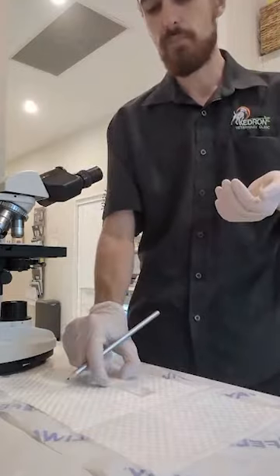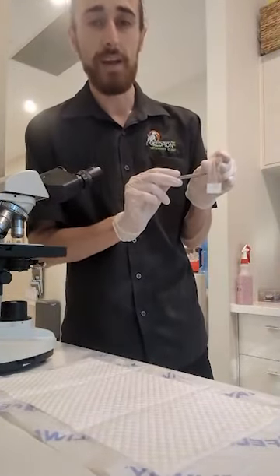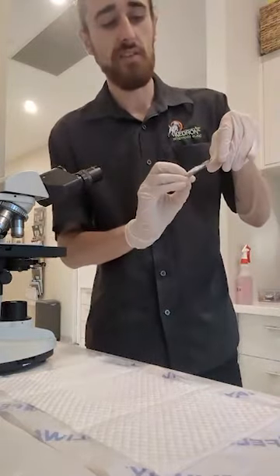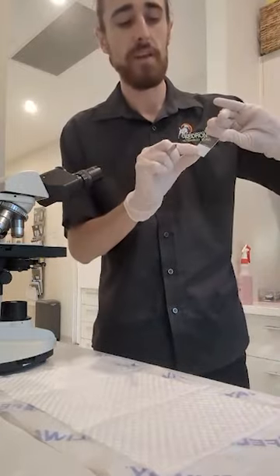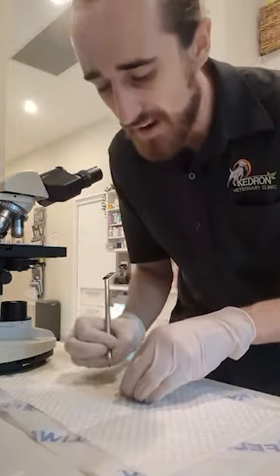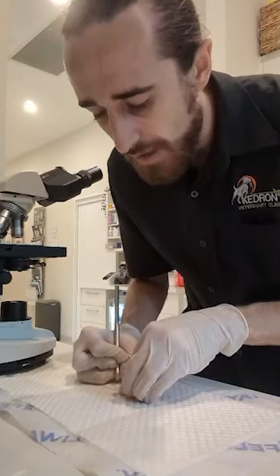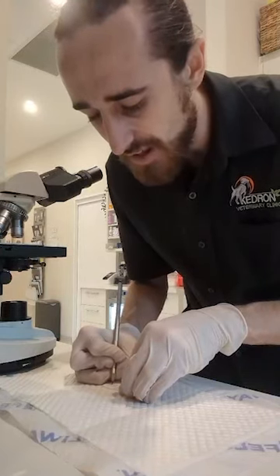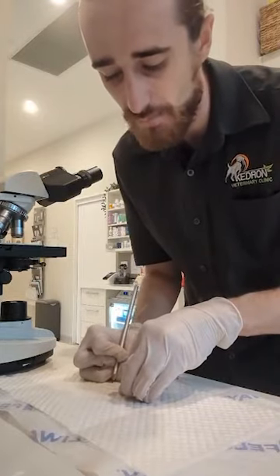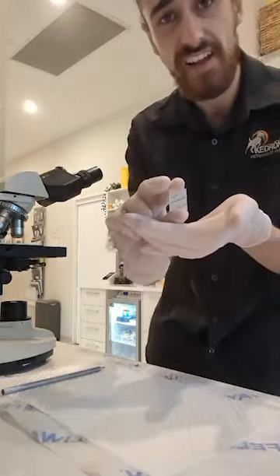Now, when we want to label the microscope slide, we want to be labeling using the frosted end away from where we are placing the sample. So we don't want to be placing it on the glass kind of flush end. We want to be writing on the frosted end here. Now, writing the patient's first name in capital letters being Lexi, and the patient's last name being Howes in capital letters, and today's date being the 16th of April. As you can see, I've correctly labeled that one there for Lexi Howes.